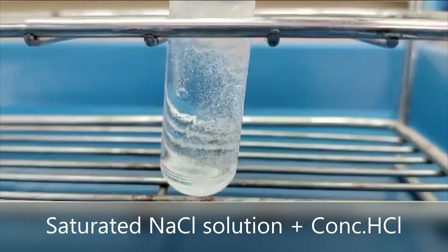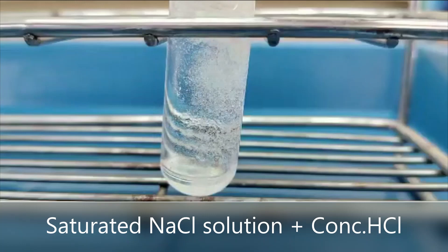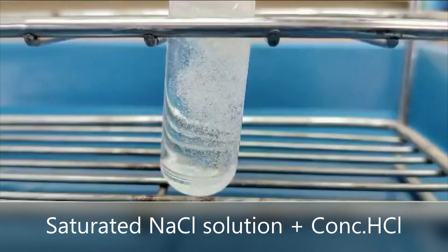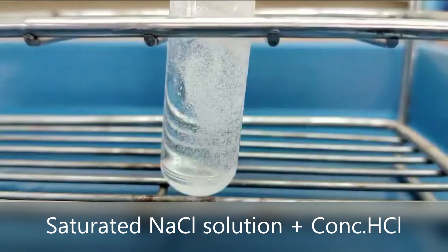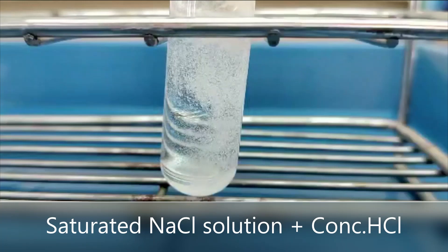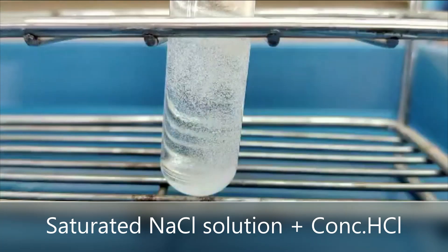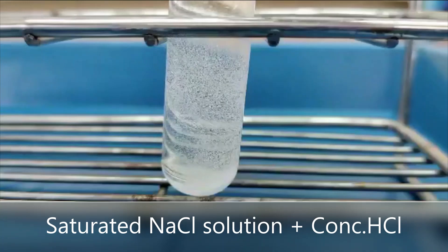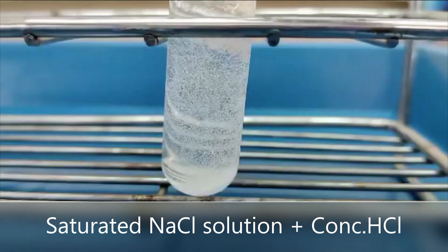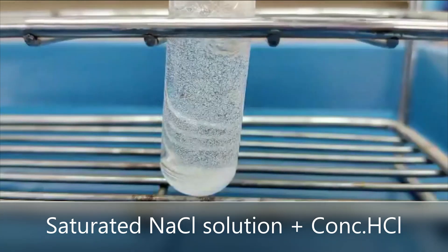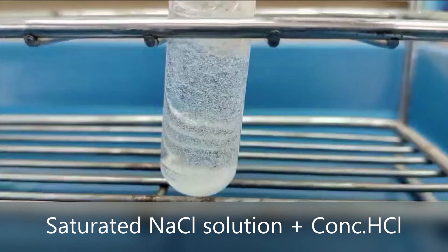Observe the experimental results obtained. What was the result of the experiment? From now on, observe the experimental results. Gradually we will begin to drip in concentrated hydrochloric acid.